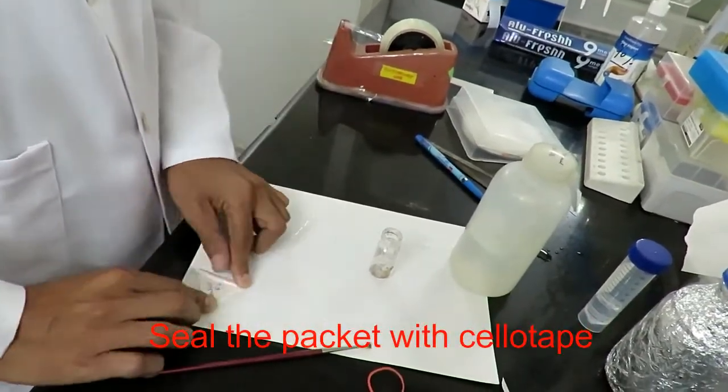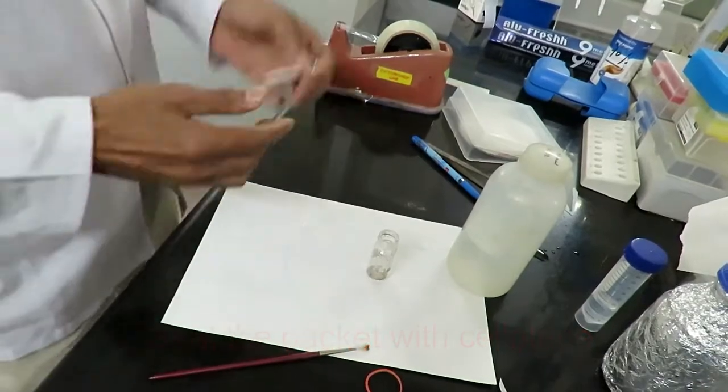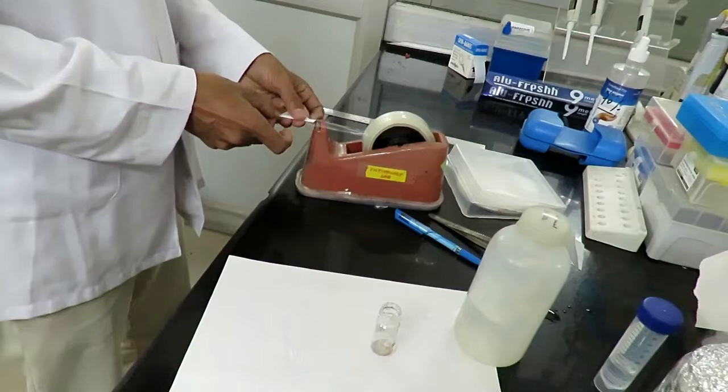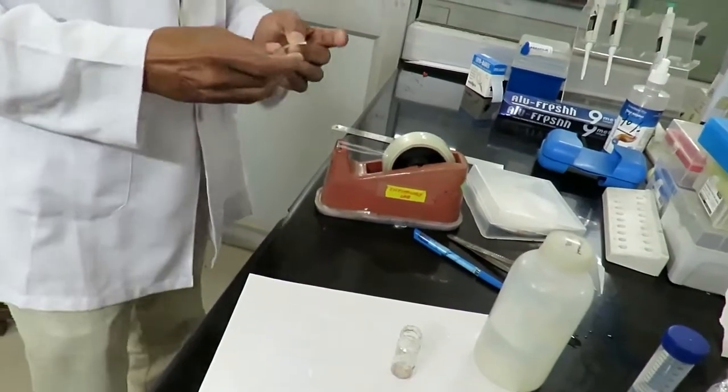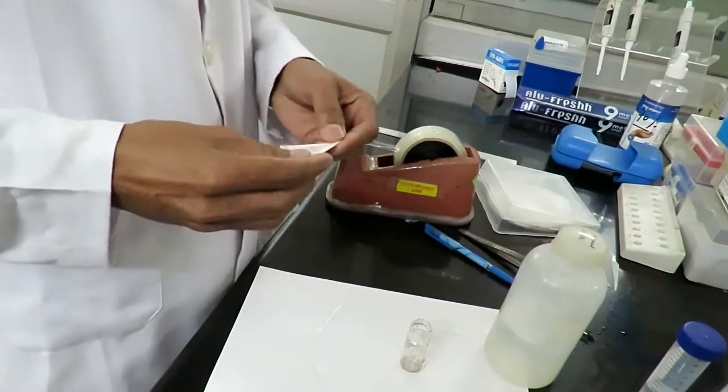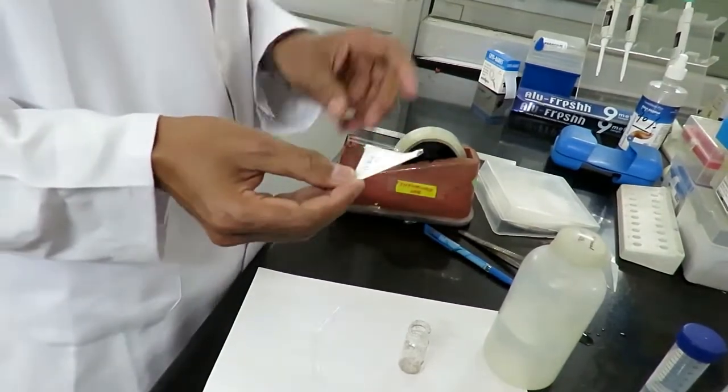After inserting the larvae into the packet, the open side of the packet is sealed with tape.